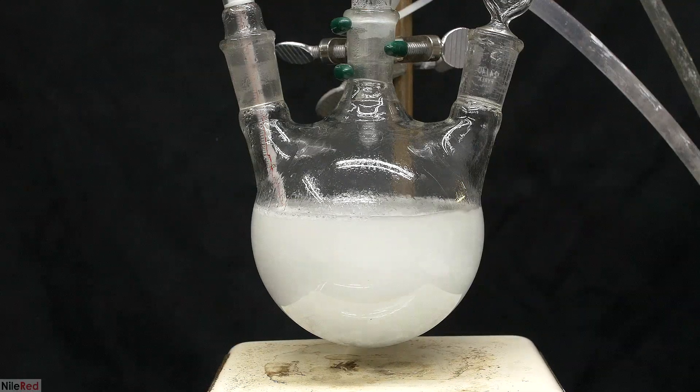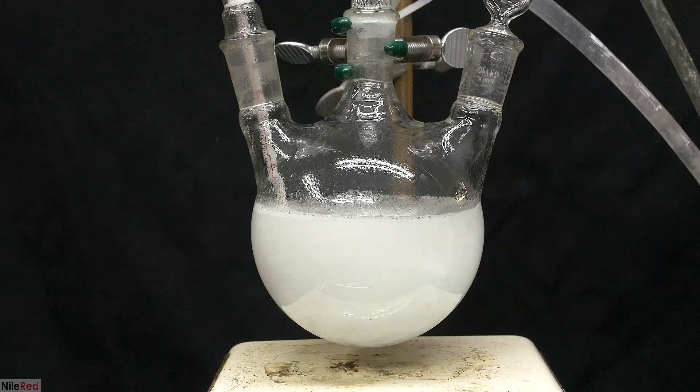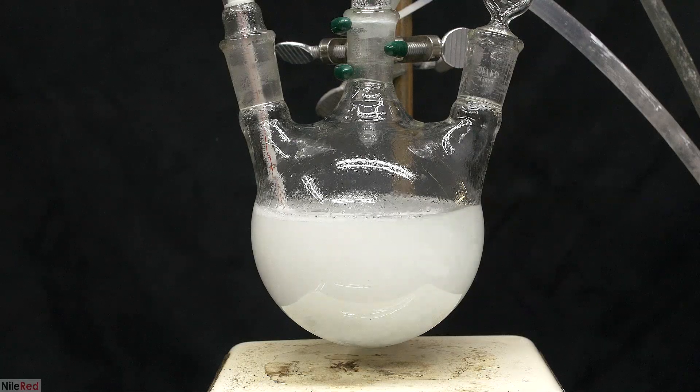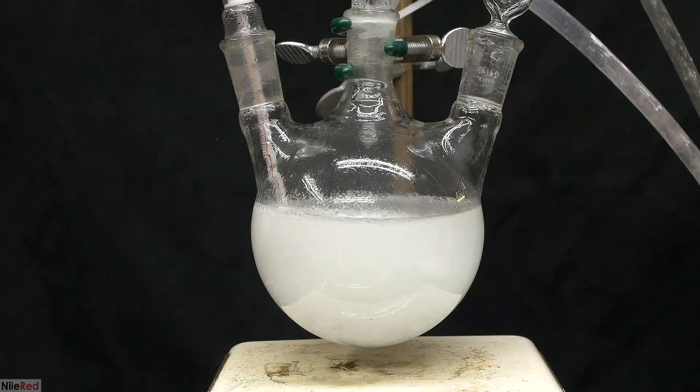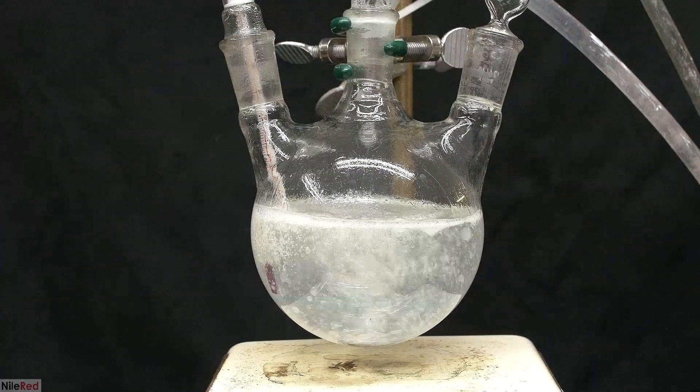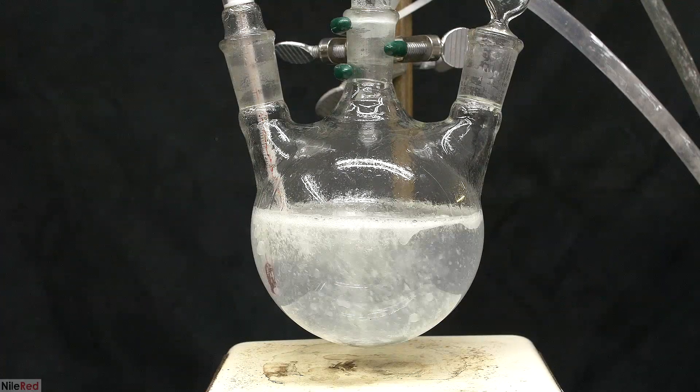It didn't get too crazy, so just like before, I just kept stirring it. The temperature rose to about 95C, and then remained pretty constant. Over the next 2 hours, the solution slowly cleared up, and started to look kind of like a lava lamp.